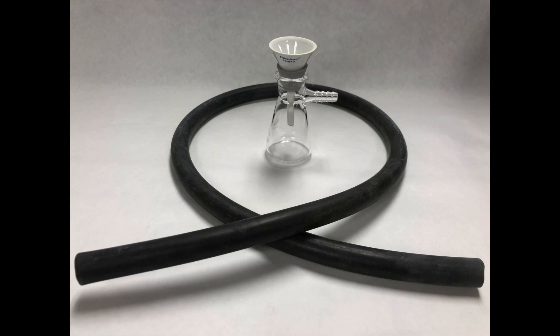You should now have a good understanding of how to use a Hirsch funnel for vacuum filtration. Good luck and have fun filtering solid-liquid mixtures in your chemistry lab!